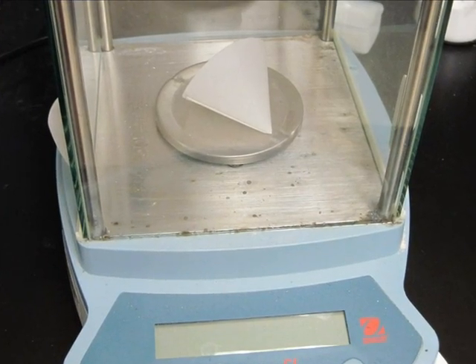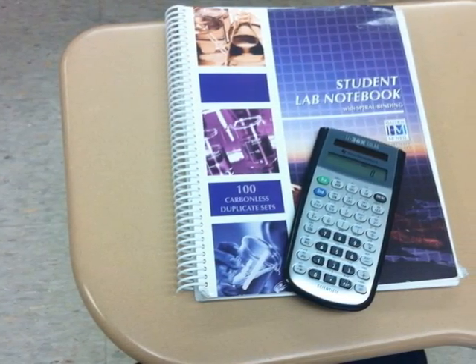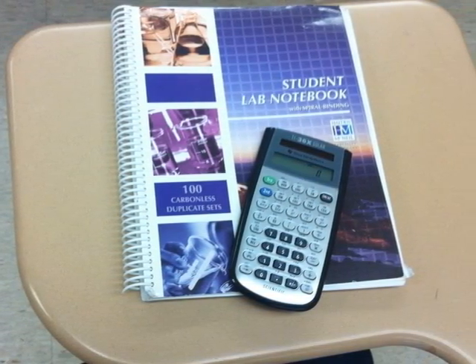The next day, weigh your dried samples. Calculate the percentage of chloride ion in your original unknown sample.